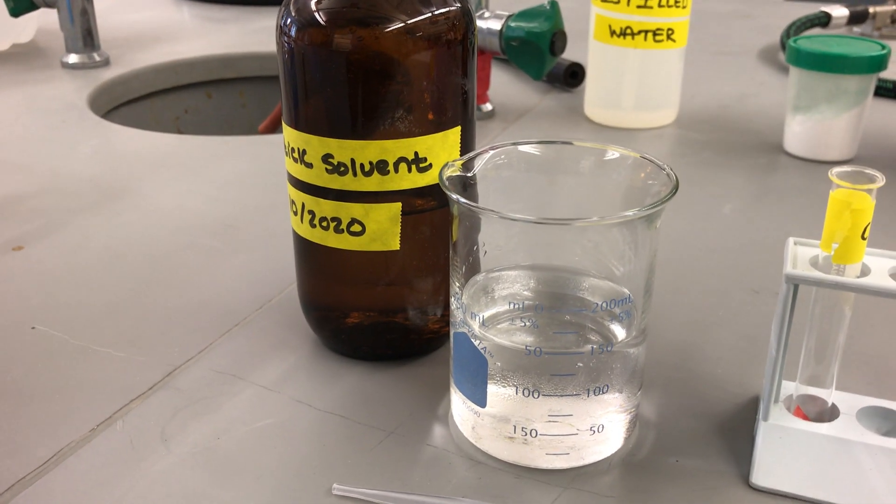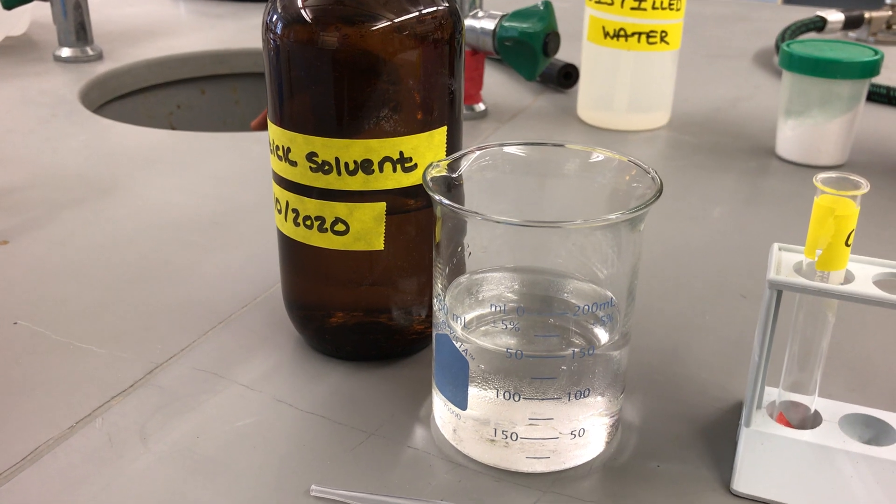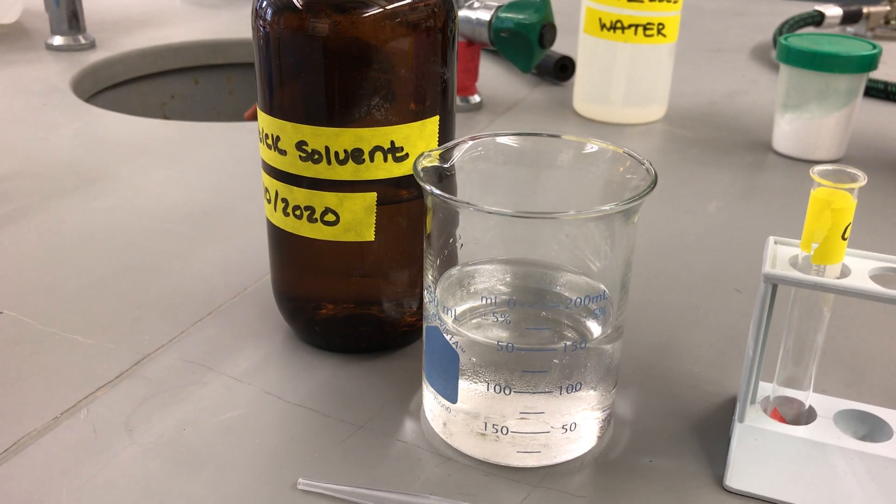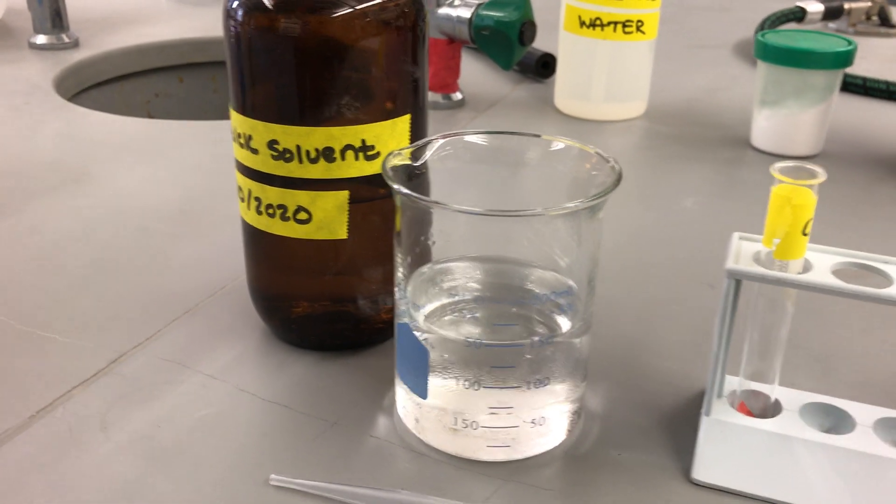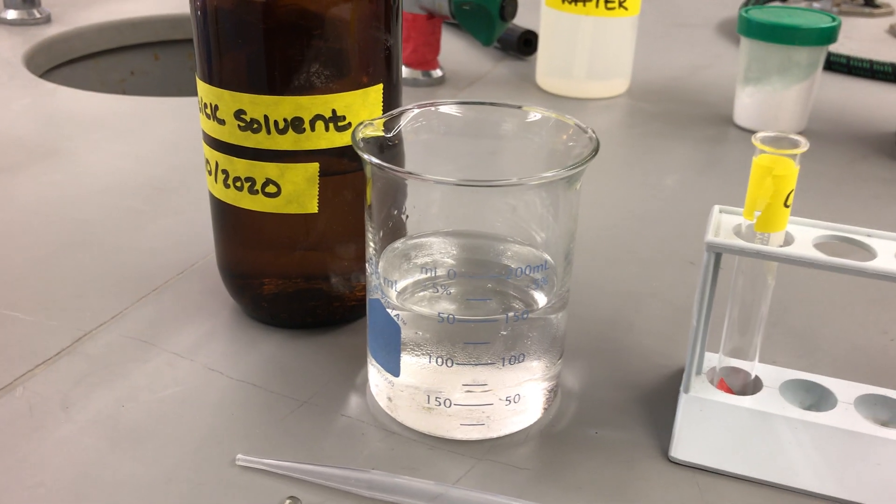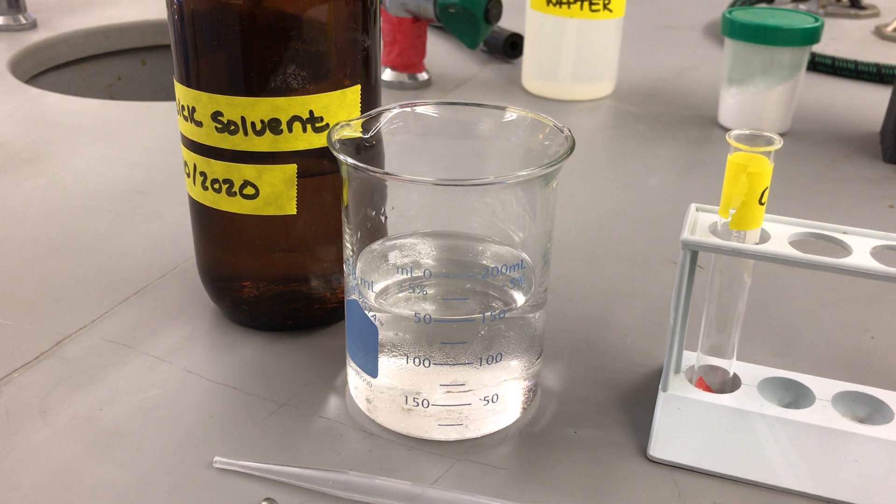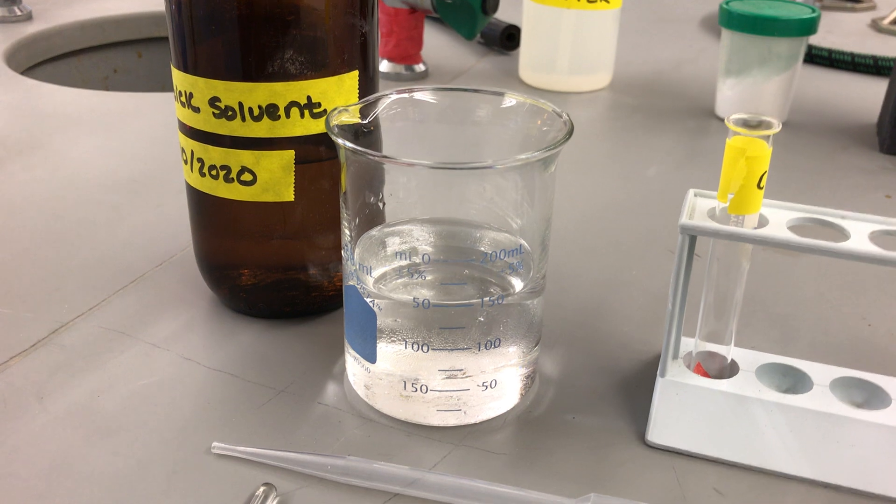Now, our solvent today is essentially a mixture of both polar and non-polar solvents. Polar solvents, when you hear polar, I want you to think essentially that it is soluble in water. So anything water-soluble will dissolve in our polar solvents.